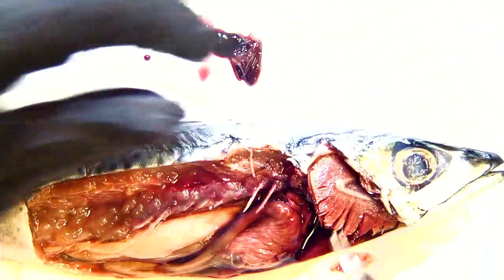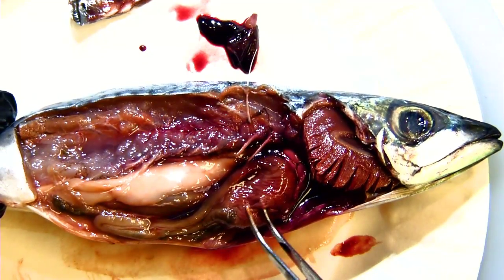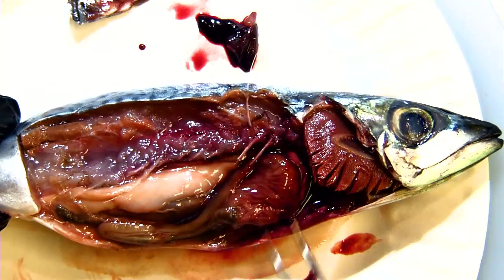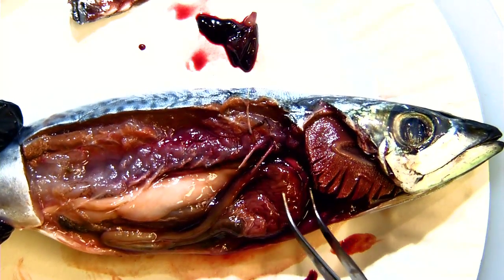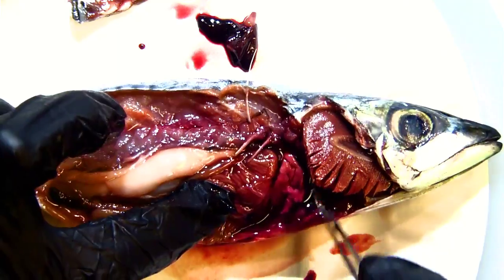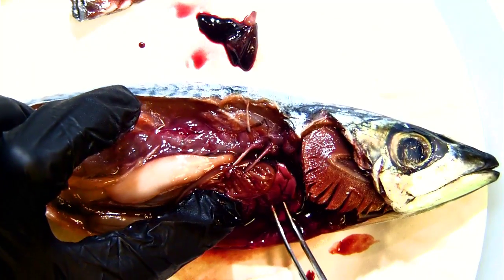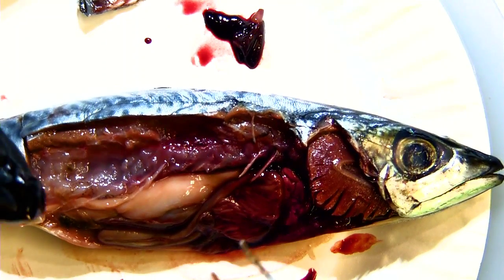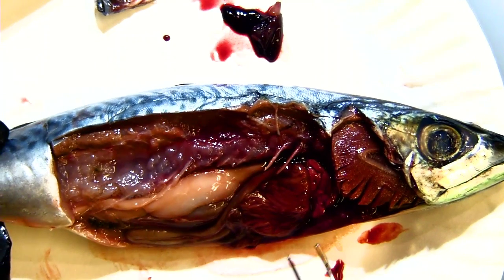The heart is located by the gills - that makes sense. Right away you also notice this area that looks like a bunch of little fingers - all these tiny parts. This is actually part of their digestive system called the pyloric cecum. This whole structure works together to help them absorb nutrients from the food they're eating - very important for getting the nutrition they need. This right here is the liver. The liver of this fish is much smaller than a shark's liver - a shark's oil-filled liver helps it maintain buoyancy since oil is less dense than water.